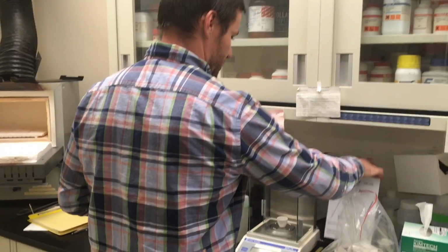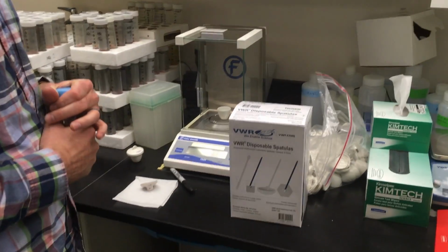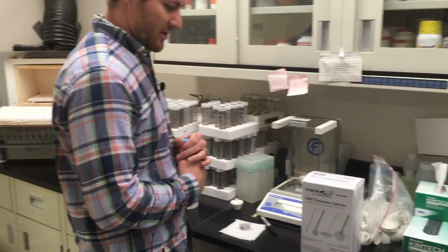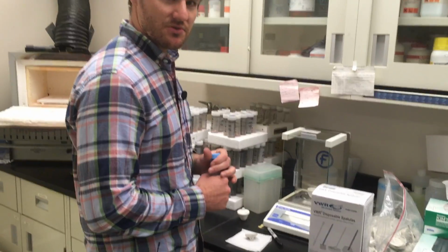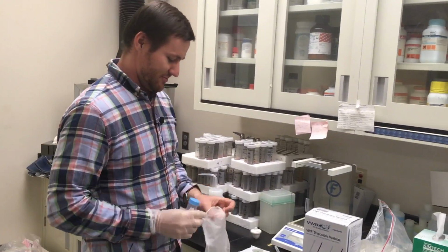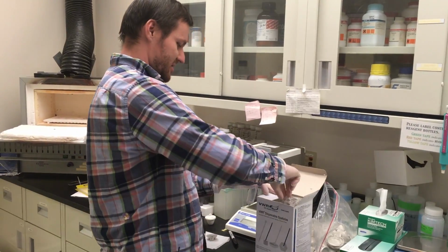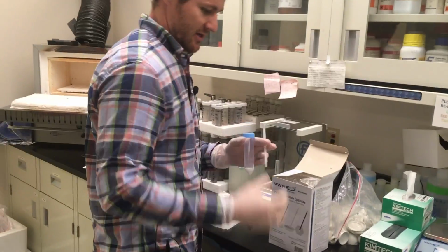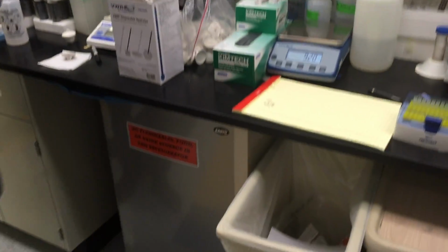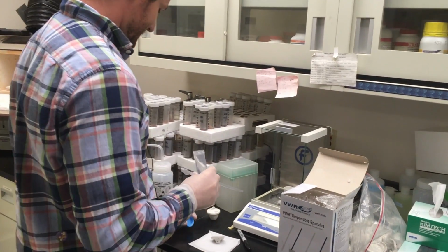And so you actually want to use these spatulas. These are nice. They're quick and they're disposable, and so you don't have to really worry about contamination. Before I do this, a lot of the times I'll actually wear gloves, and so it's important to put gloves on in this step. Now we are ready to weigh our sample. Grab one of these nice disposable spatulas. I like to prime my trash can for disposal. And again, let's try for 20 milligrams. We'll see how good I am at this.